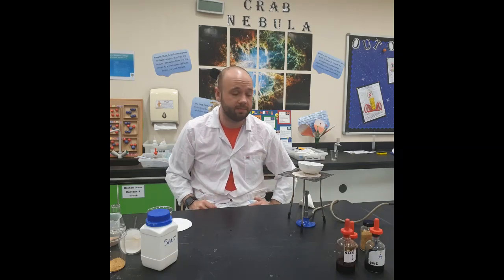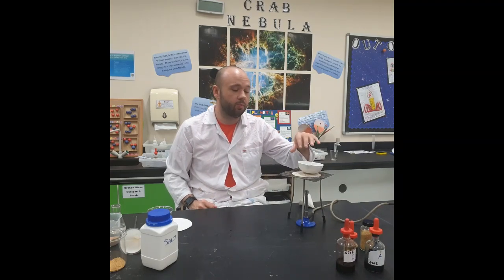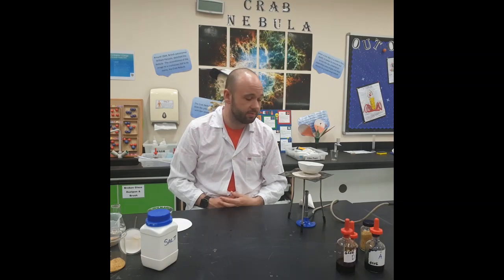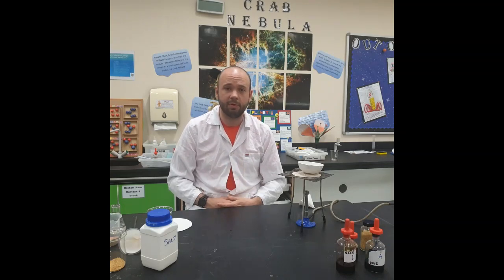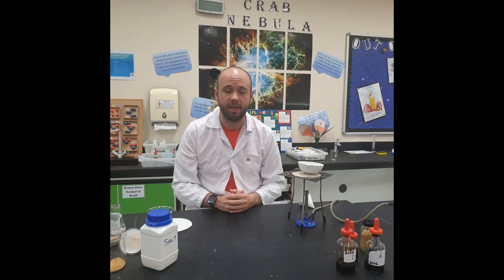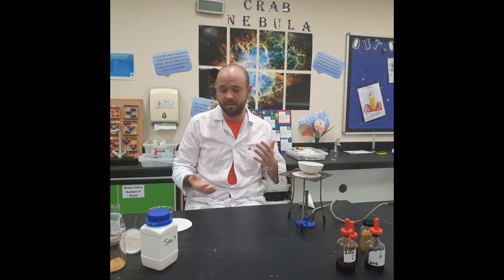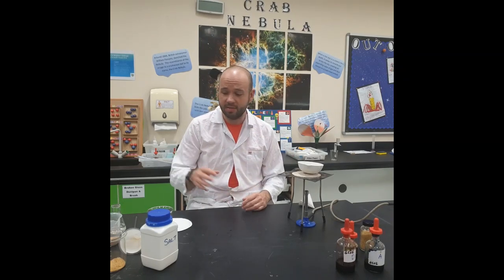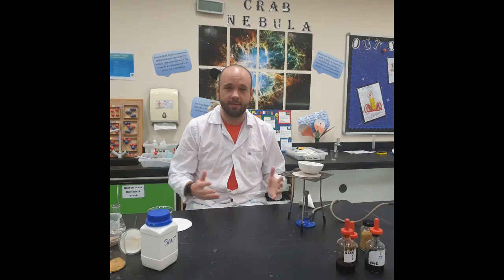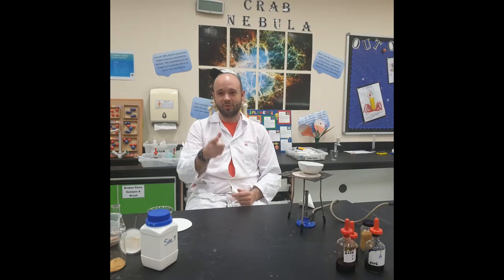What will happen over those 5 to 10 minutes? All the solvent, all the water will evaporate because its boiling point is approximately 100 degrees, and the boiling point of salt is much higher than that of water, so the salt will remain behind in our evaporating basin. Okay, so that is a method, two methods that we can use to separate a mixture, something that is insoluble, which was the sand, and how do we separate something that is soluble? We can use evaporation. Okay, go and do your work.